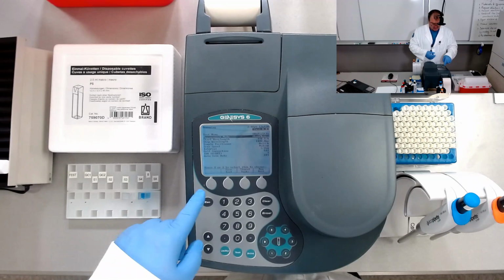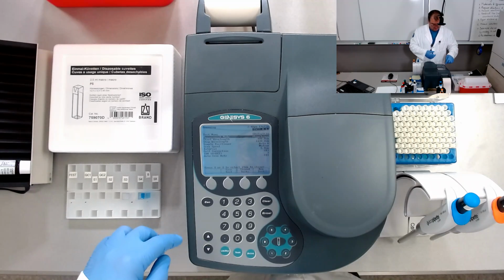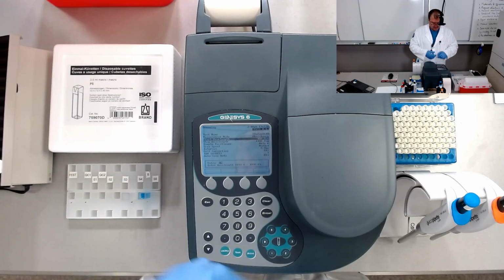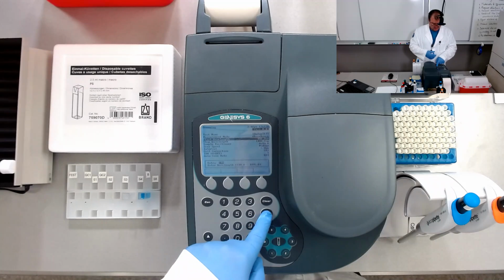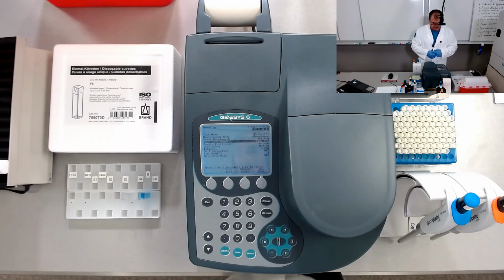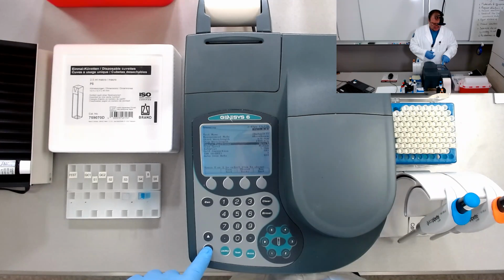enter. We are going to have absorbance mode, so the measurement mode will be absorbance. For wavelength, we'll start from, let's think, 190 nanometers, deep in UVC, remember that, and let's go to a stop wavelength of 1100, which is in infrared. That's very good. Okay, so we go down, sample positioner auto 6.